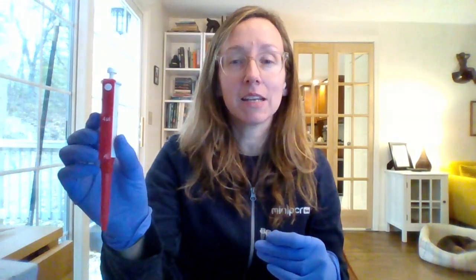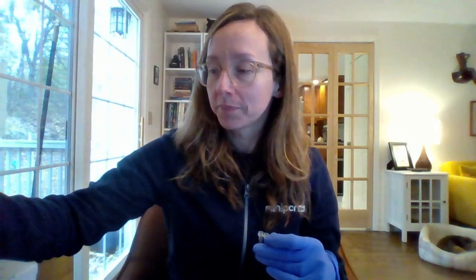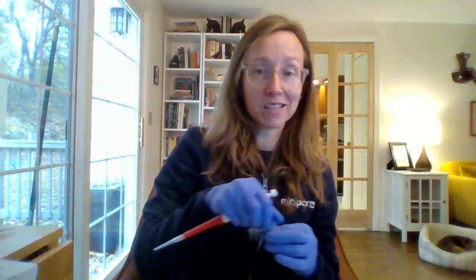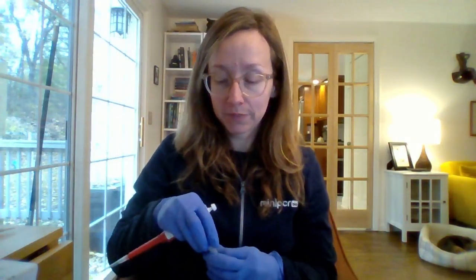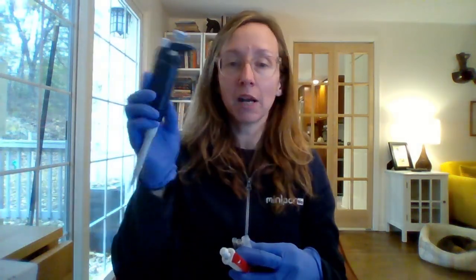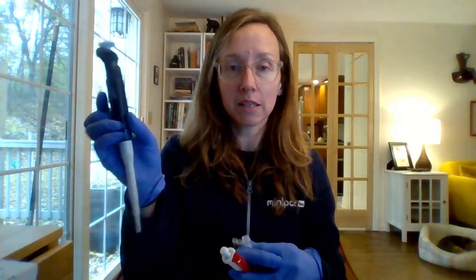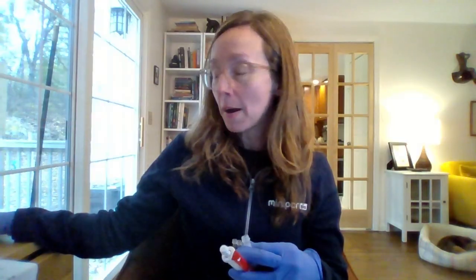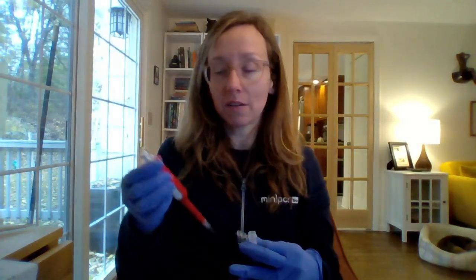Today I'm going to be using this mini pet. It is a fixed volume micropipette, and it always pipettes 4 microliters. Now I'm using this mini pet today because it's a great classroom tool. Mechanically, it's very similar to a standard variable volume micropipette. So the one that looks like this, that has a little window there, you can dial in your volume. Mechanically, it's very similar to that variable micropipette.